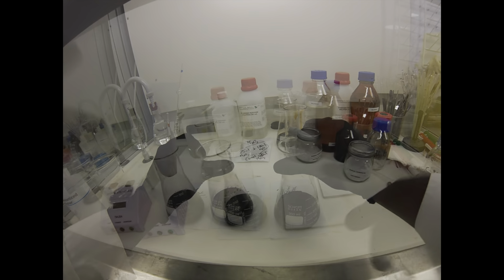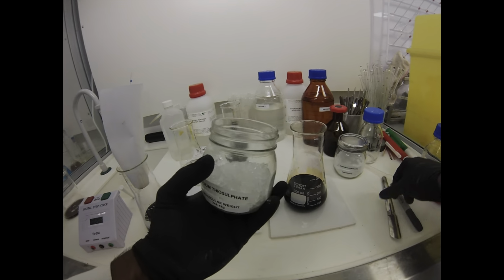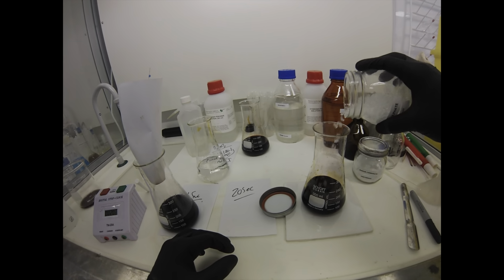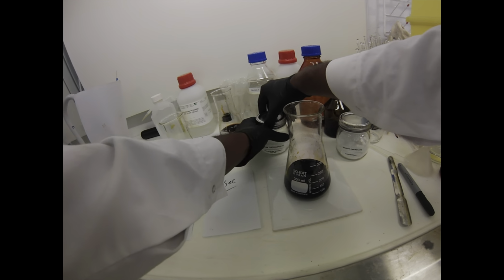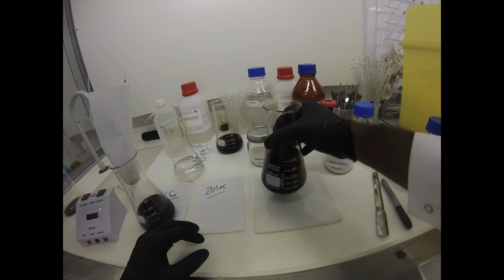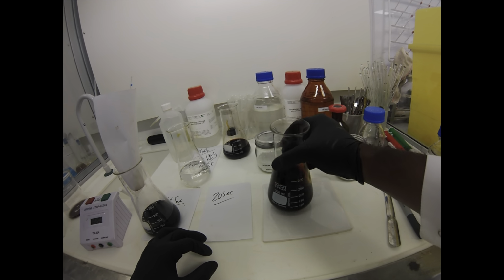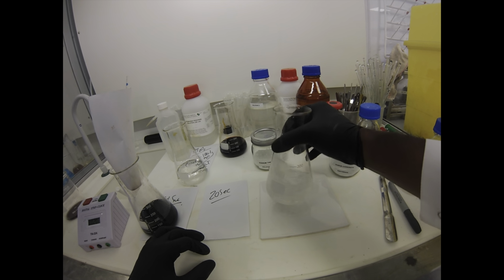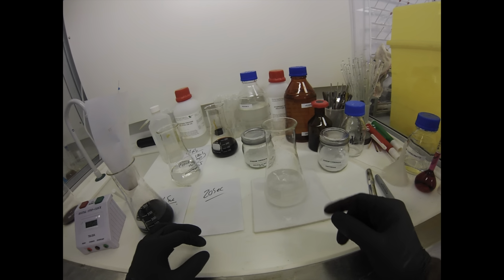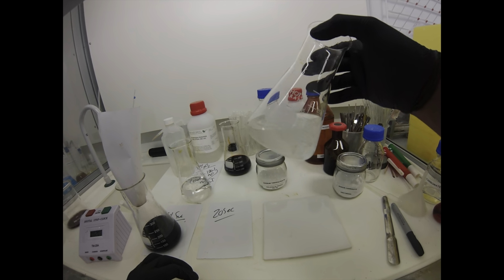Let's just finish up with disposal. We've got sodium thiosulfate again, and we're just going to put that in excess, basically. We are going to do that slowly, and then we're just going to stir it out. What you'll find is that it might go clear. So if I give it a real good stir and get some of that to dissolve in, it should begin to go clear. And then what will happen is on standing, that will go back to being brown or black.